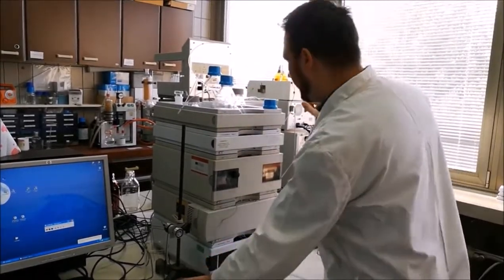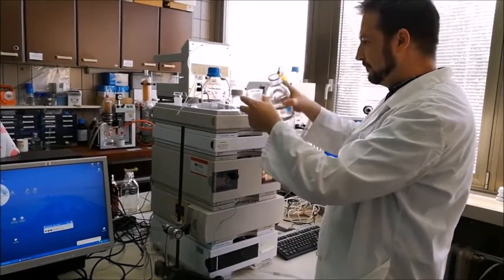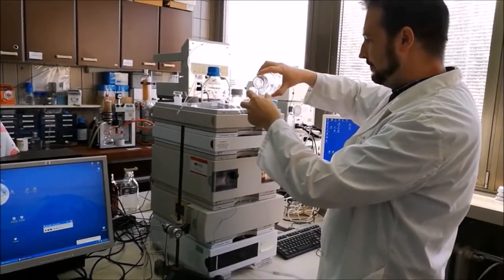So we will transfer a small amount into the beaker.